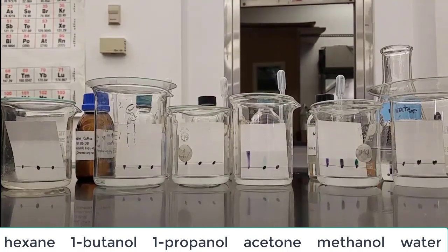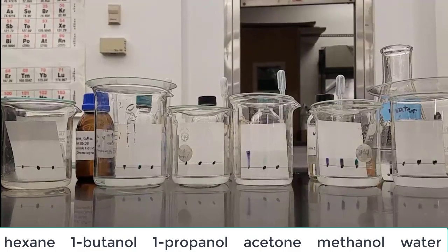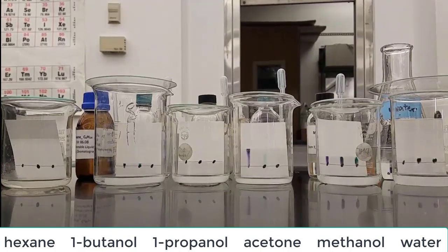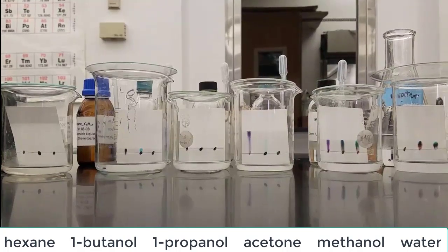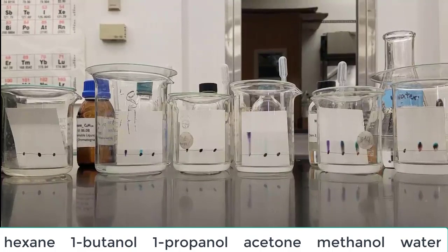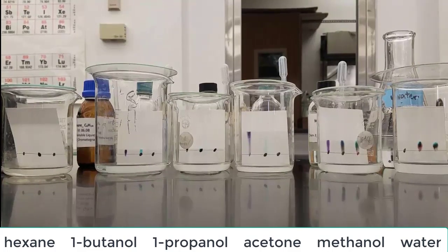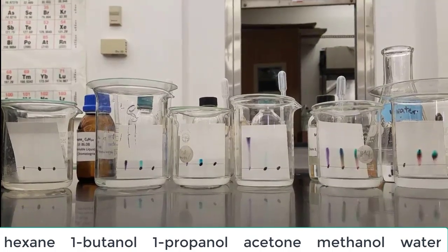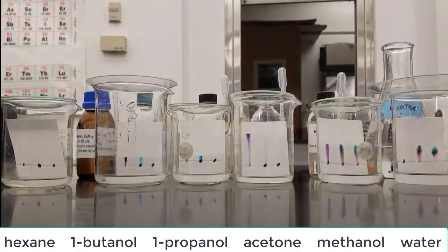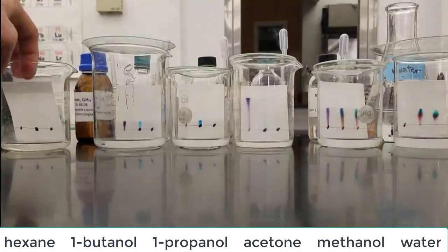Over a second from the right, that's methanol, and the inks are definitely moving in the methanol. You can see all three inks are dissolving pretty well in the methanol. That means that those inks are very much like the mobile phase. Methanol is the mobile phase. All the liquids are mobile phases.